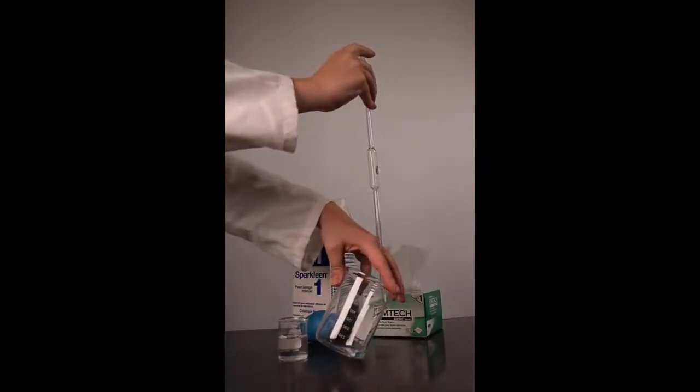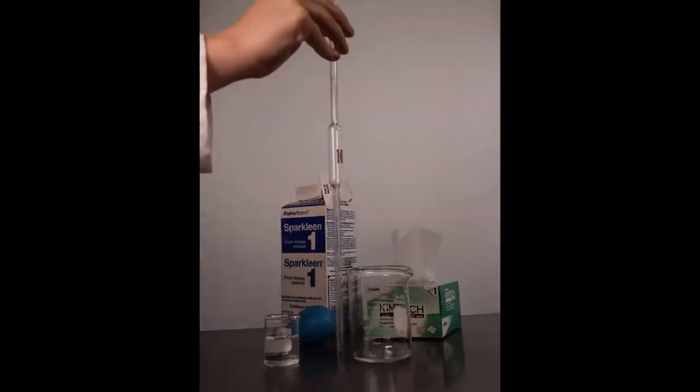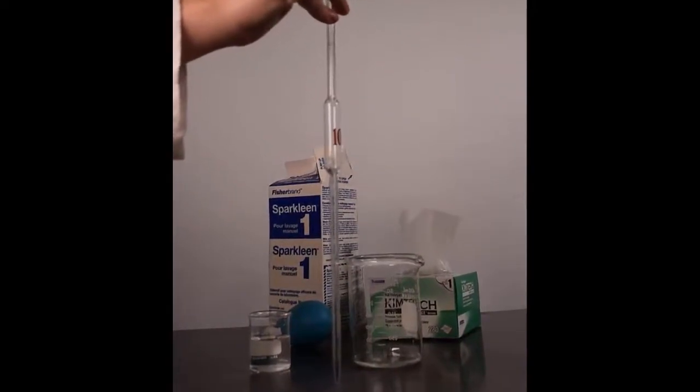Check the cleanliness of your pipette again. Distilled water should drain out cleanly, leaving no drops behind. You now know how to clean a pipette.